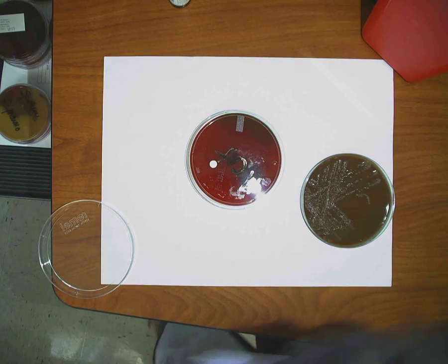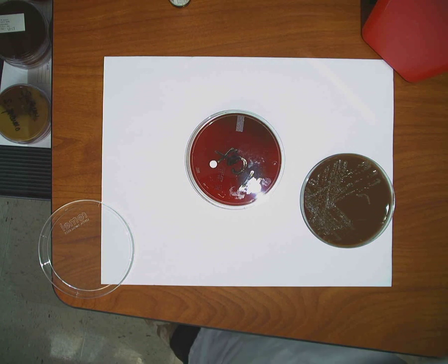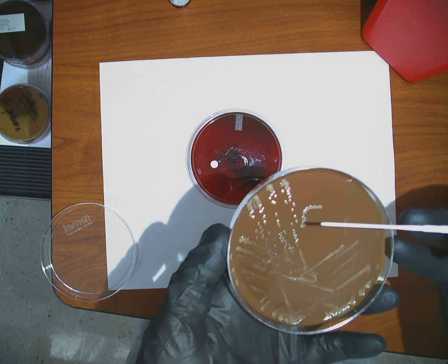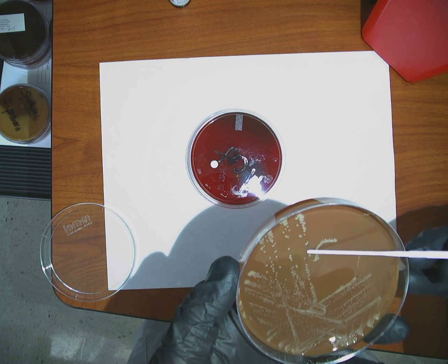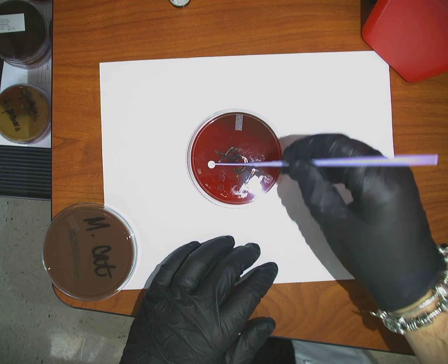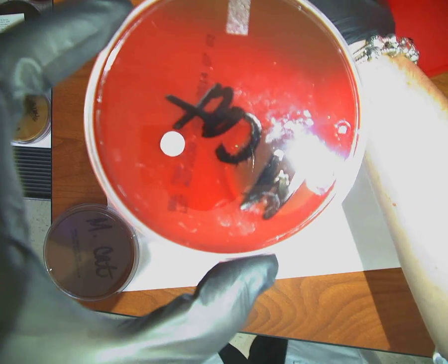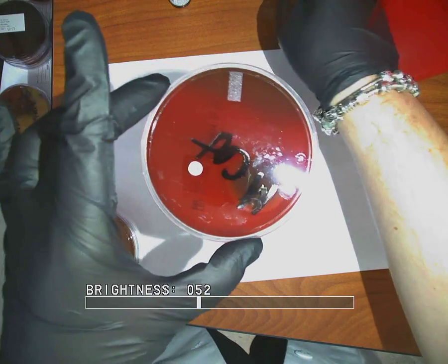So what I'm going to do is take a sterile loop, and from my chocolate plate, I am going to pick up colony that I suspect to be Moraxella. And you want to pick it up from the isolated area, okay? So I'll pick up one of these, and a couple of these, okay? I take it and I rub it into the disc, and I watch for a color change. I don't know if it's going to do it or not. Let's see here, take the lamp off.